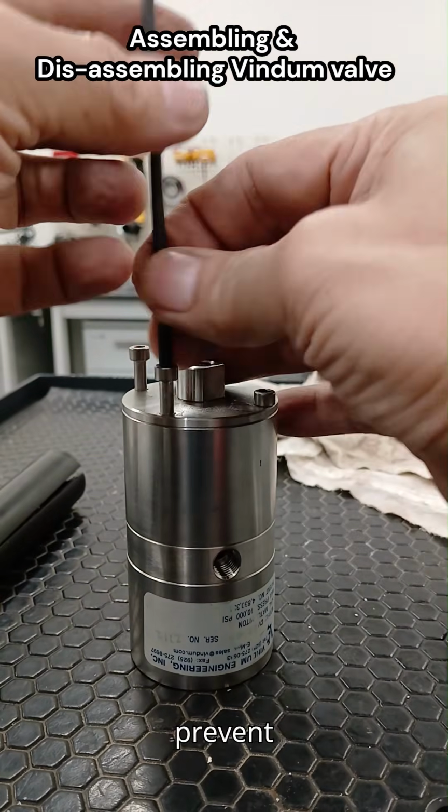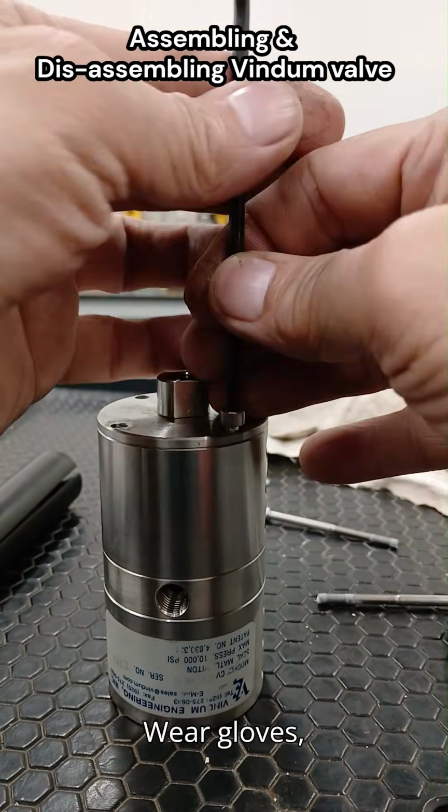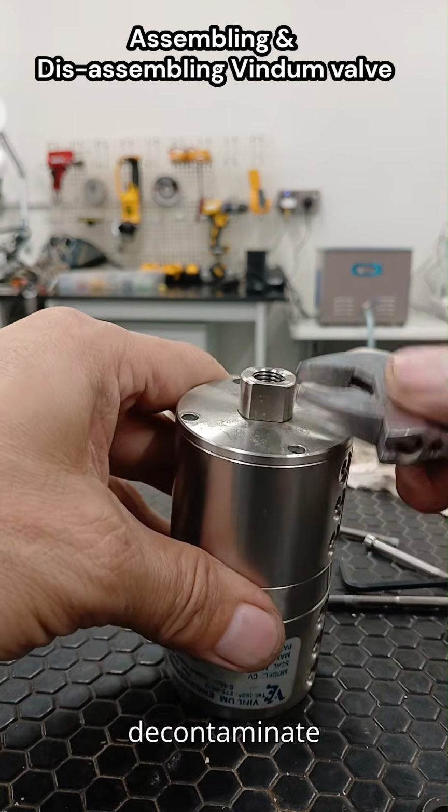Important before you start: Work in a clean environment to prevent contamination. Follow manufacturer specifications for torque and parts orientation. Wear gloves, finger oils can affect sealing surfaces. If the valve handles hazardous chemicals, fully decontaminate it first.